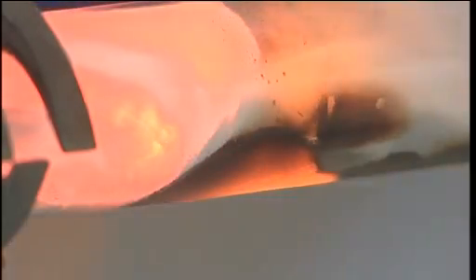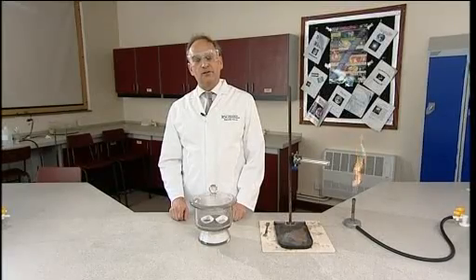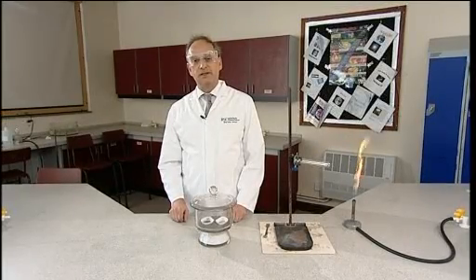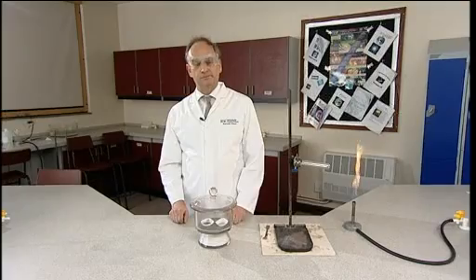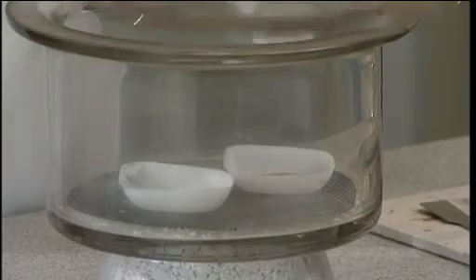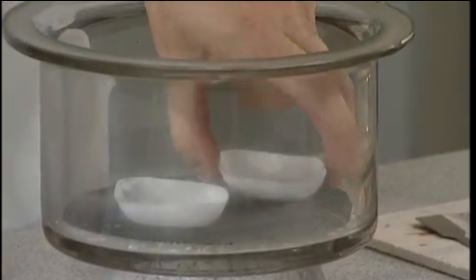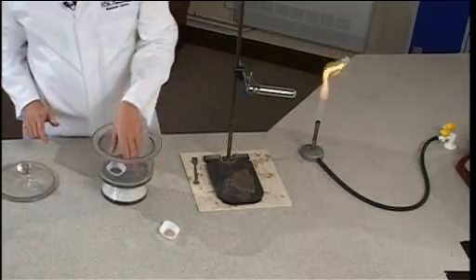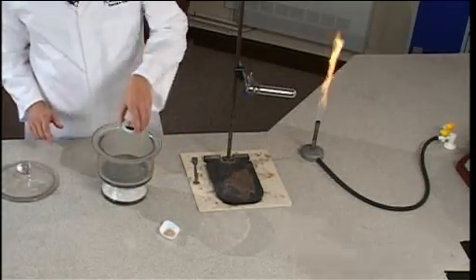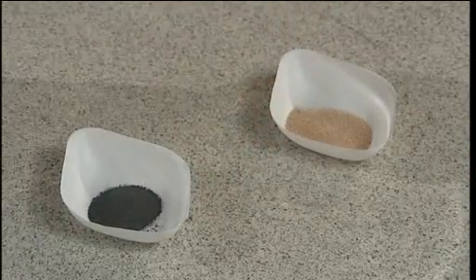This is the reaction between magnesium powder and silver sand, which is mostly silicon dioxide, to make silicon. In the reaction there are also some interesting and spectacular side reactions. What you use is one gram of silver sand, which has to be dried overnight in an oven and stored in a desiccator, and one gram of fine magnesium powder.